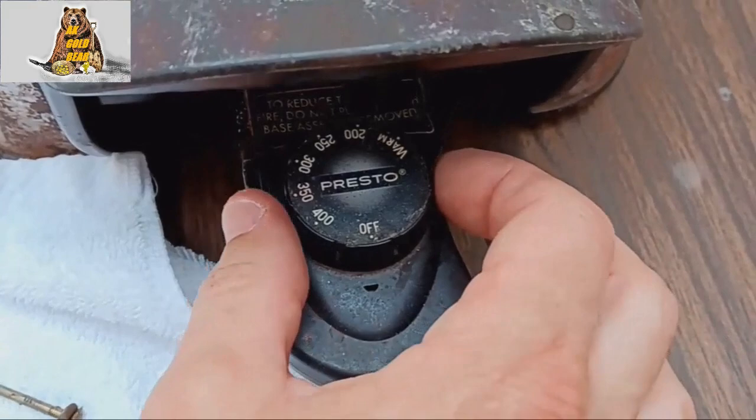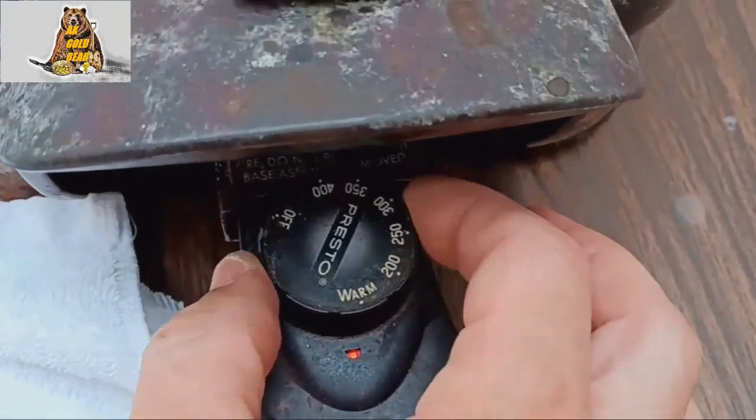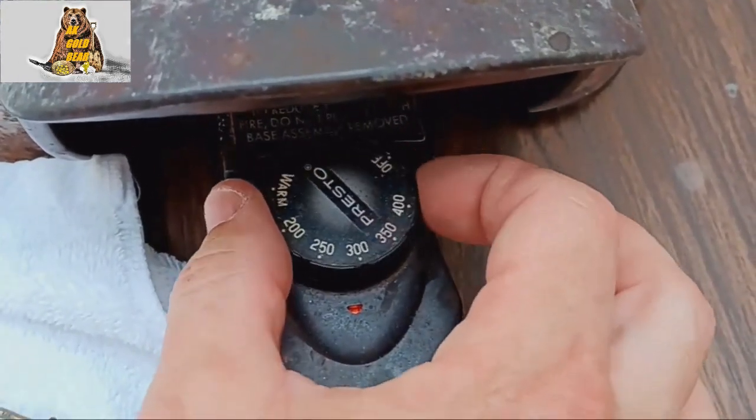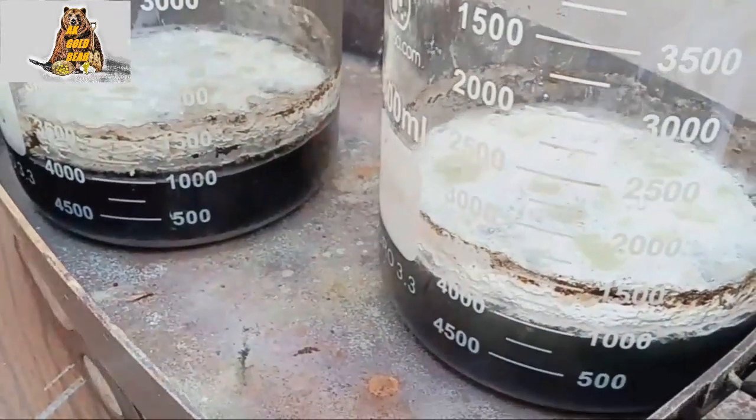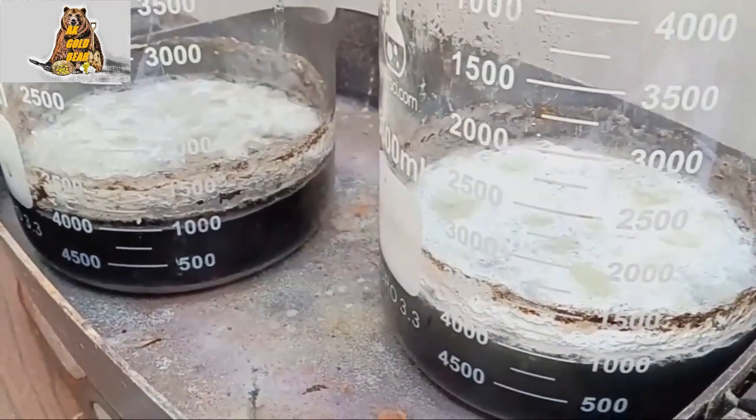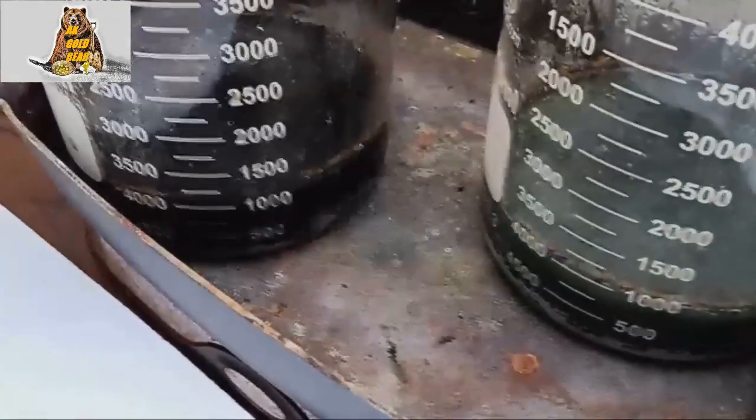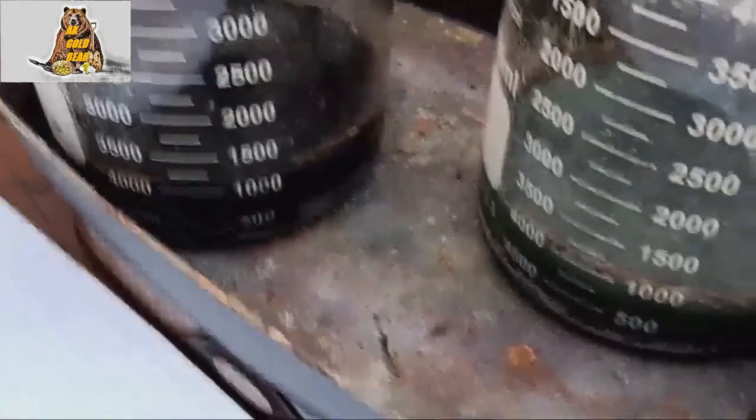Okay, I'm going to turn on heat, because reaction slow down now. After four hours, the metal dissolution reaction completely stopped.